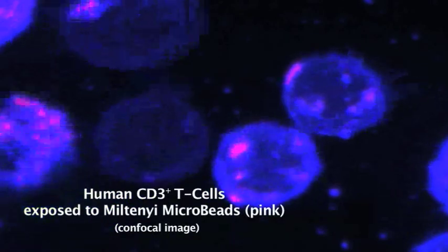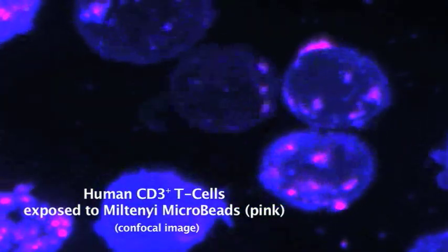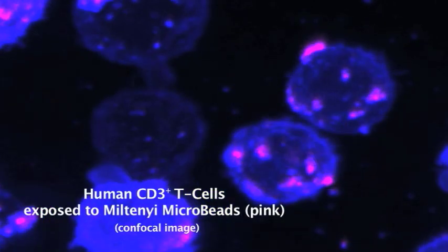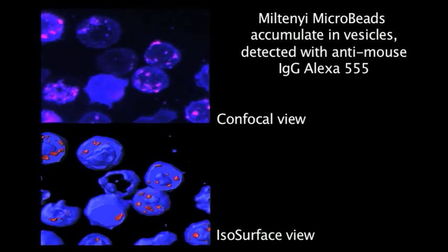Here we see peripheral blood mononuclear cells prior to exposure to Miltenyi human CD3 microbeads. However, once the Miltenyi microbeads are added, binding and uptake of the microbeads in pink can be tracked using confocal microscopy. The cells and Miltenyi microbeads can be more easily visualized using isosurface imaging.